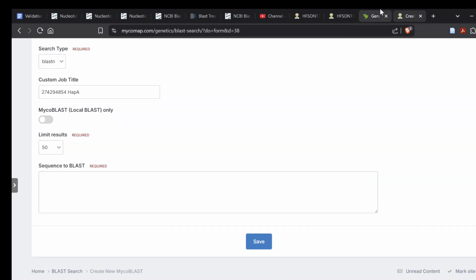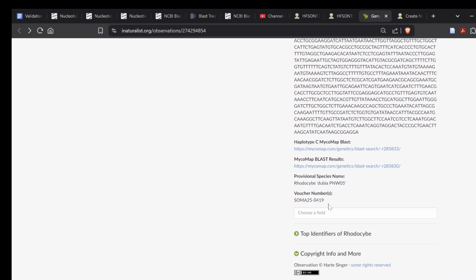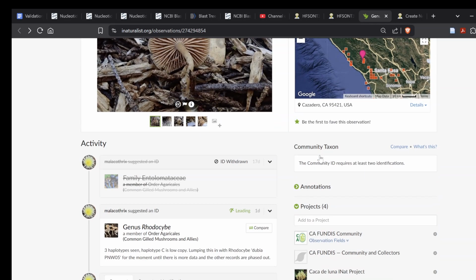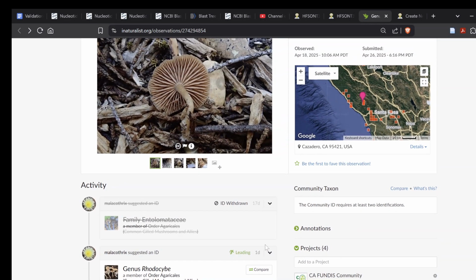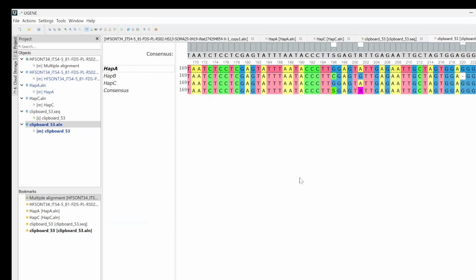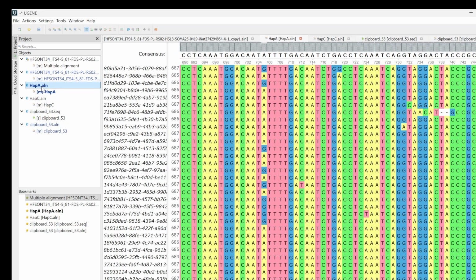Create a new BLAST search, do haplotype B. Create a new BLAST search, do haplotype C. And add the BLASTs. It's really that simple. Sometimes it's not. As I mentioned, this one isn't perfectly clean. Some of these haplotypes still have a little bit of wonkiness happening in there.